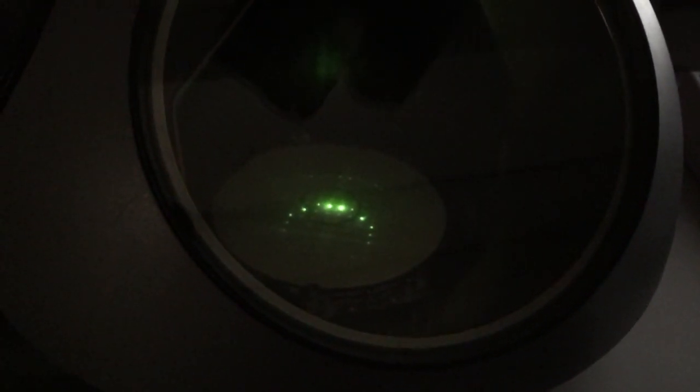So to proceed from here, I go back into bright field mode. I'm going to center my objective aperture around my direct beam. I'm then going to go back into dark field, and I'm going to finally position the Bragg beam within the objective aperture so that they're both along the optic axis. And then we'll take a look here and see how the images turned out.